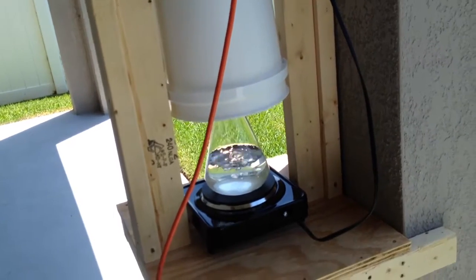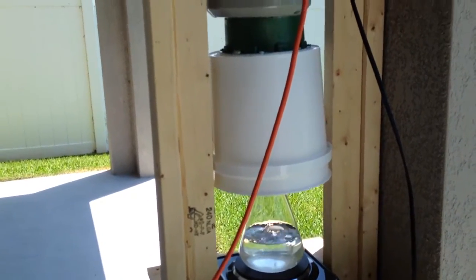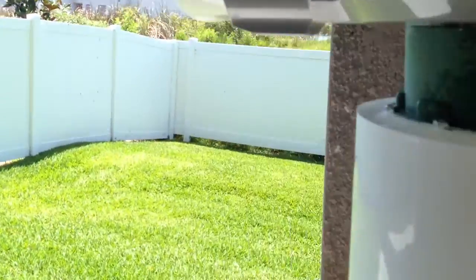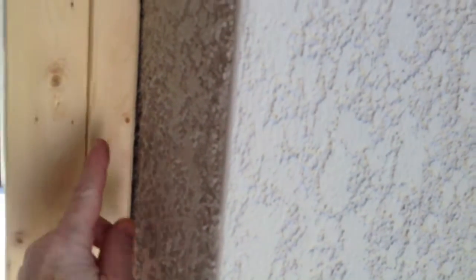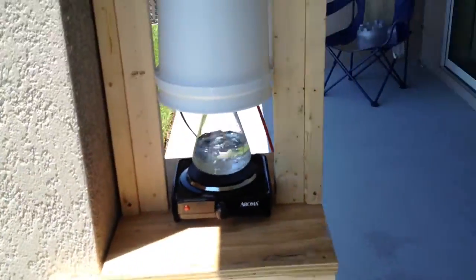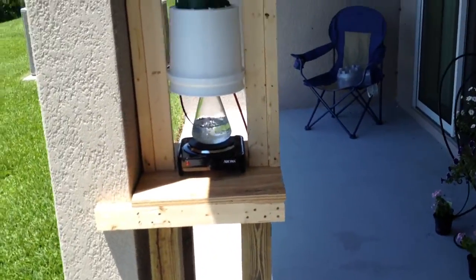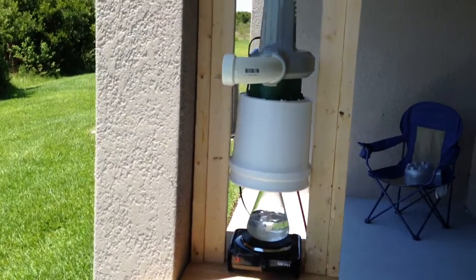So I'm pretty confident that vapor is not going to be hanging around the flask where I'll be working. The one last part of this, I'm going to clean up these electrical cables, probably just mount them down here and run the cables so they're kind of out of the way. I may even permanently mount the burner. I'm going to use it for a few weeks to see what happens. I might have to replace those if I have spillovers.